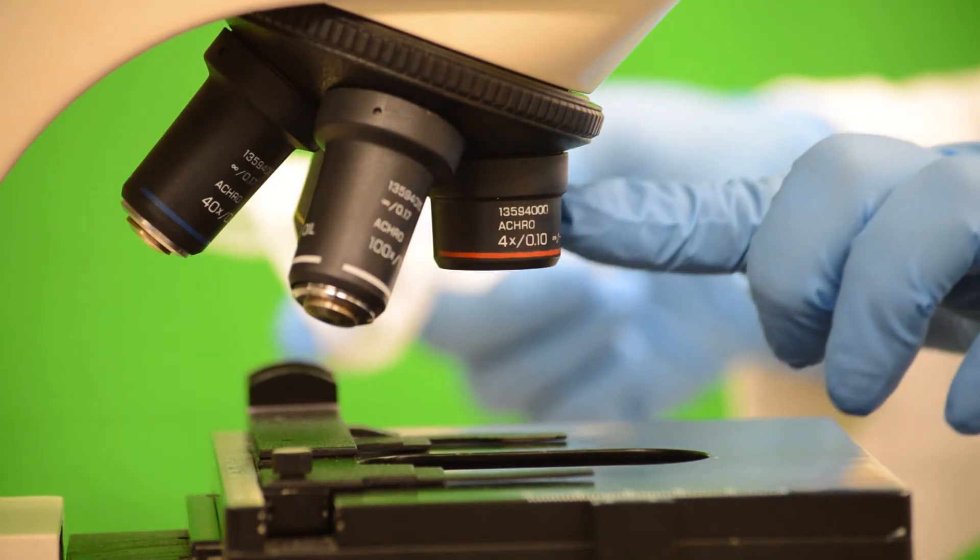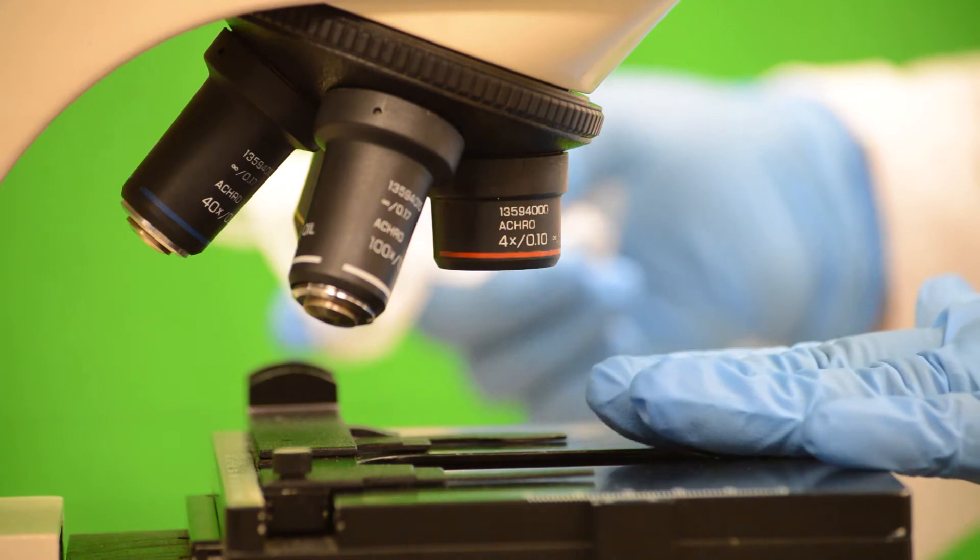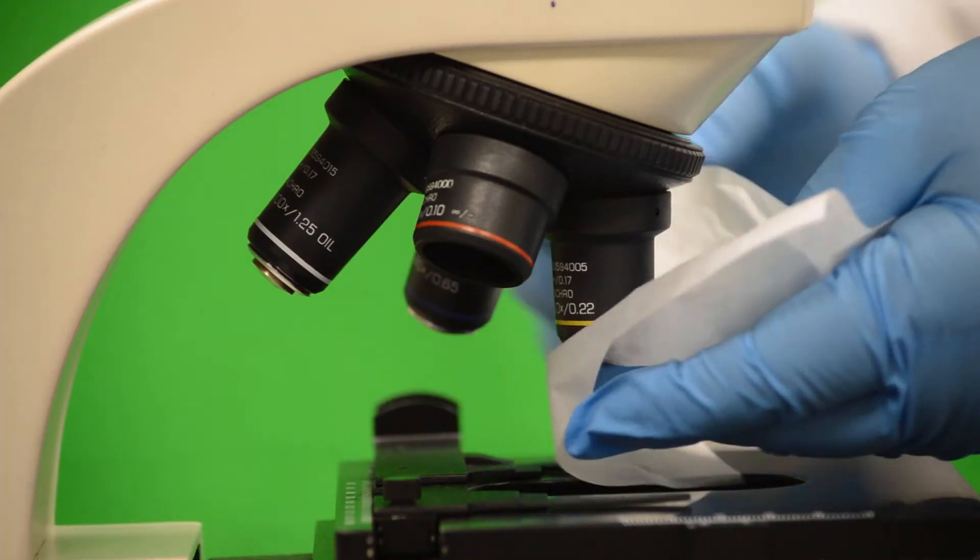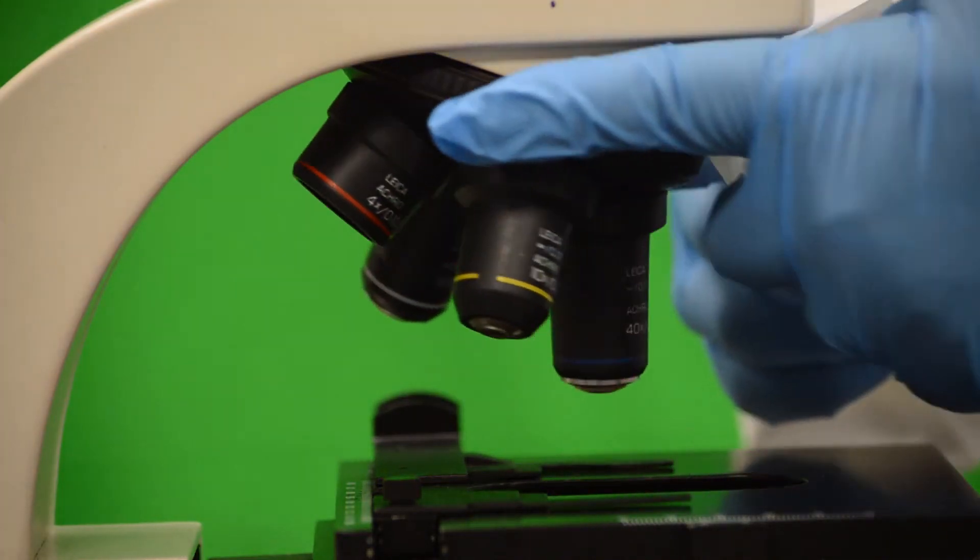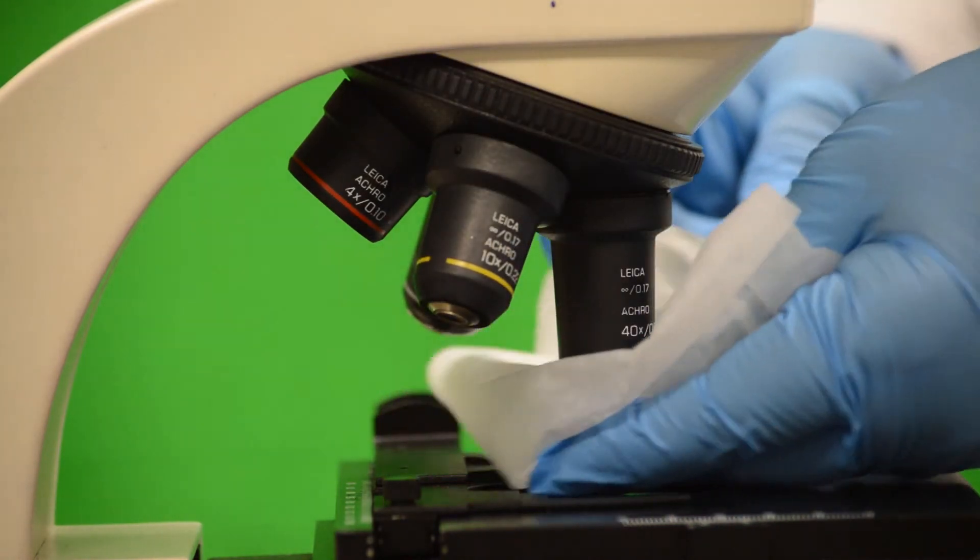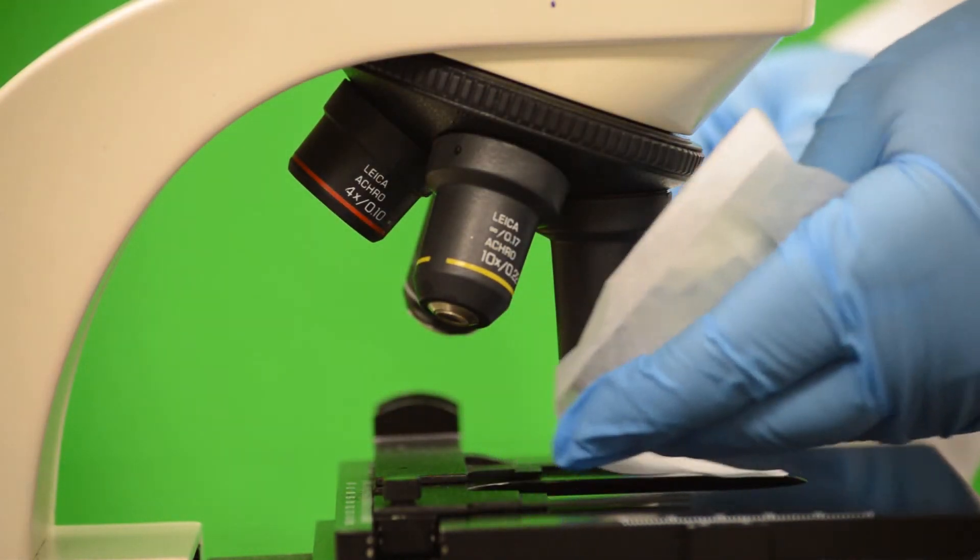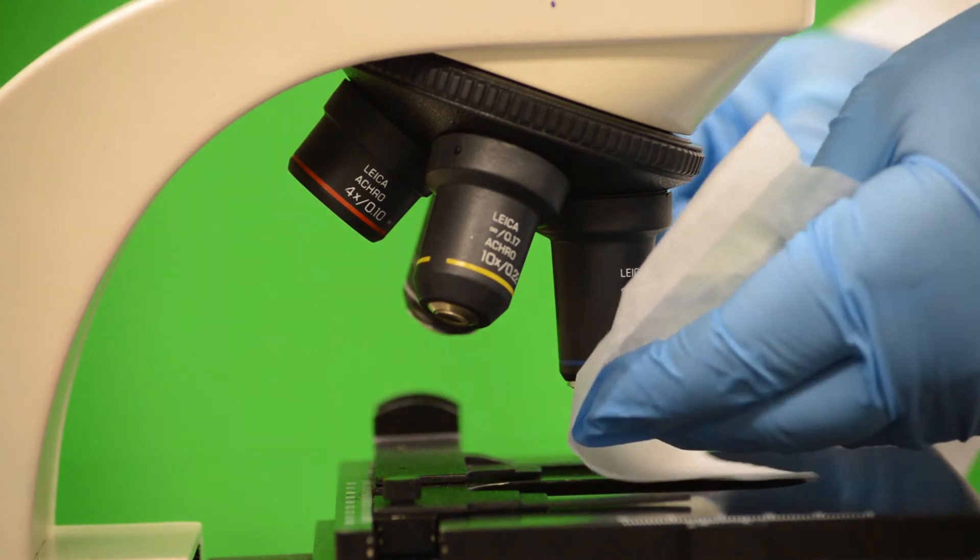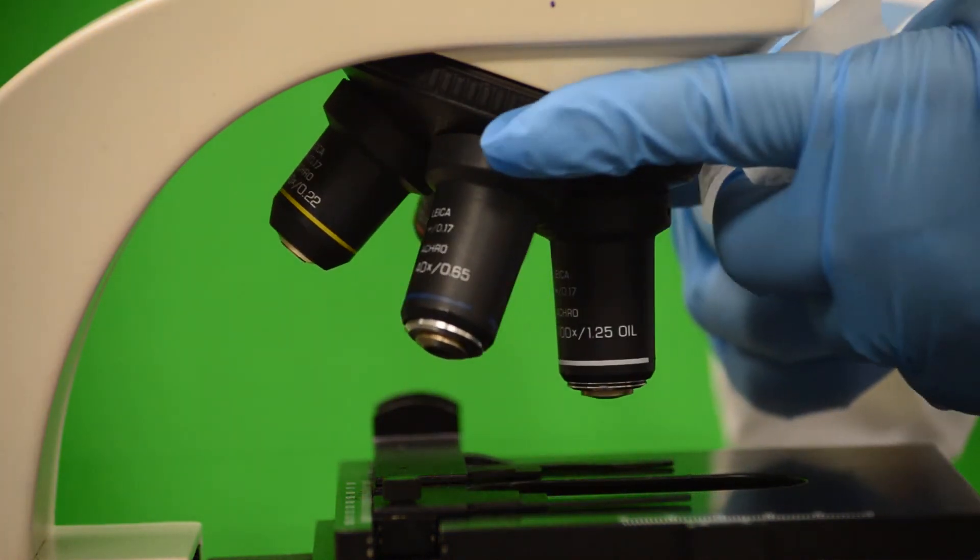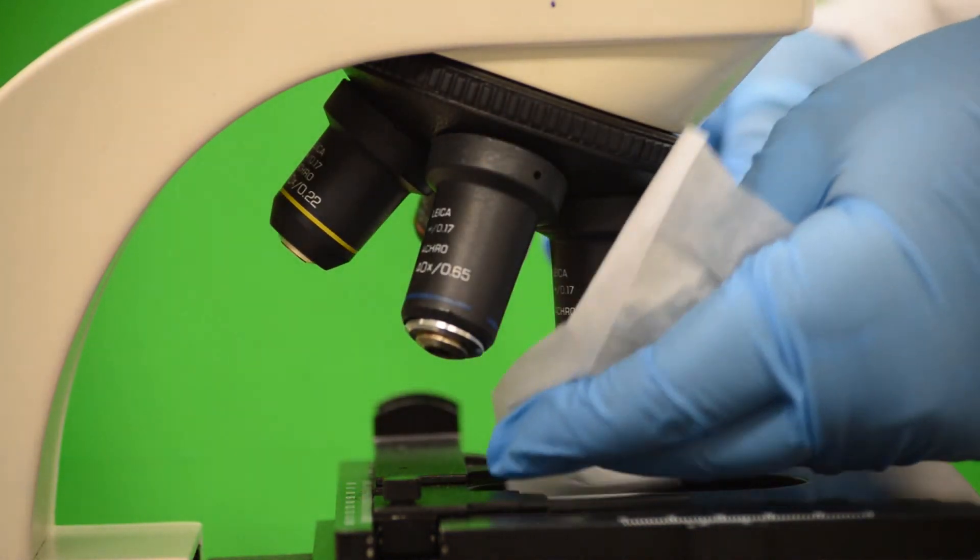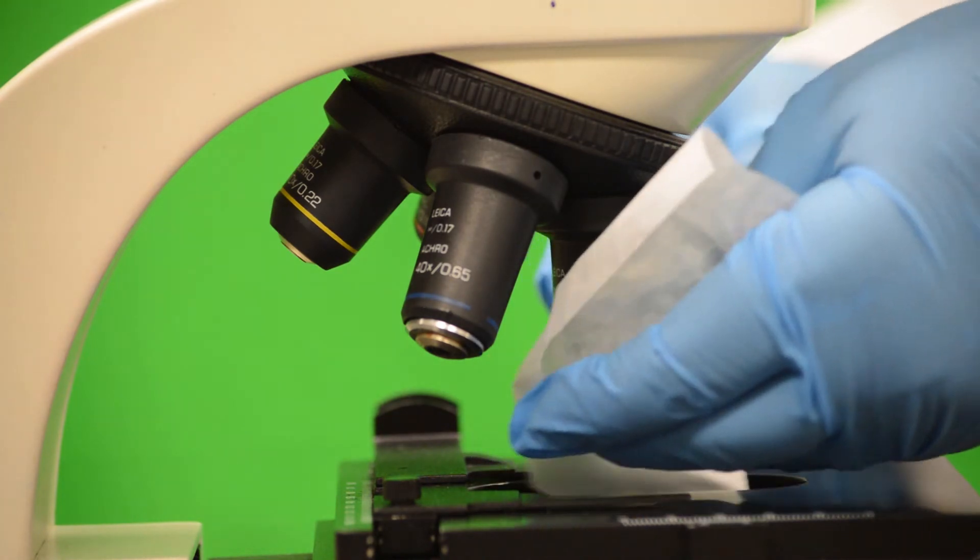Place the lowest power lens, the shortest one, closest to you. Remember to clean off all lenses before putting the scope away, especially the oil lens, with lens paper and cleaning fluid. Pick the scope up with two hands and then return it to where it was stored.